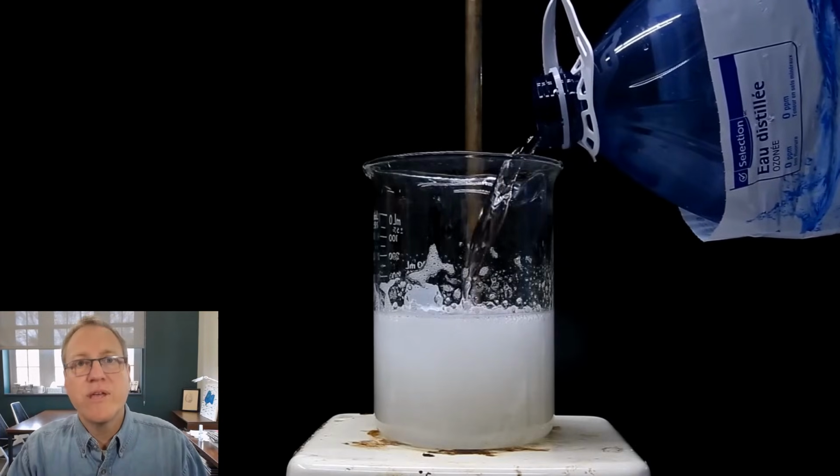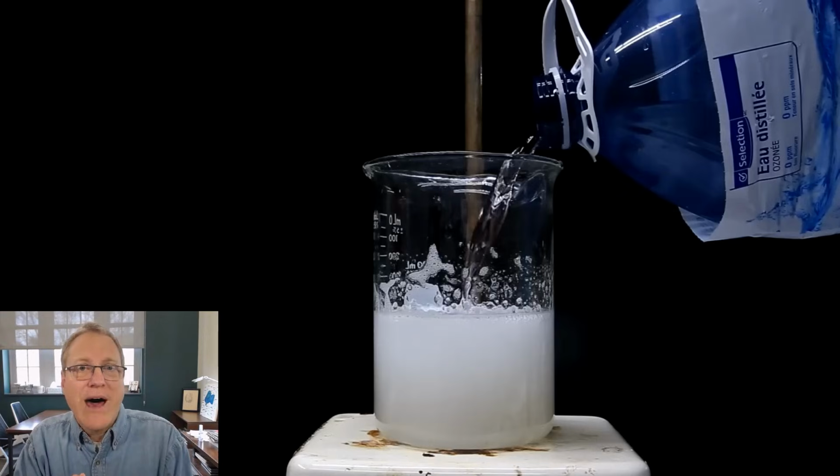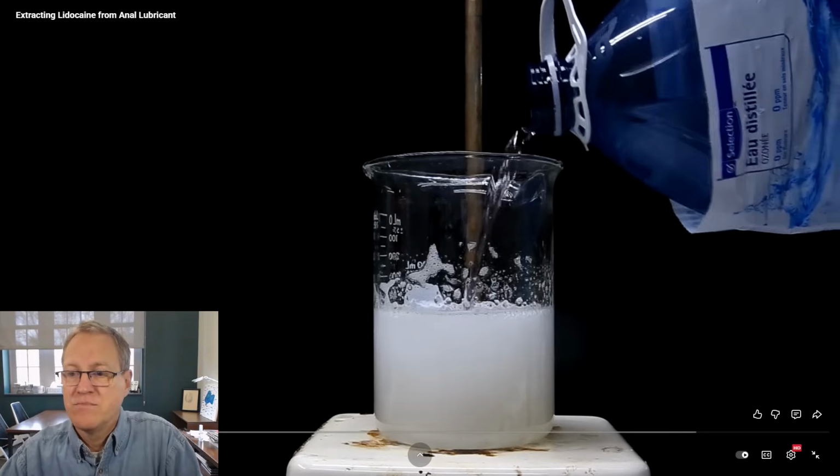Now listen, I'm not looking at this material in real life, and NileRed is, but my suspicion is that it's not a homogeneous mixture, it's that it's still so thick, there's not a whole lot of water in there, and therefore it's still quite a thick material. And as you swirl it around, you trap bubbles in, and the bubbles just make it so you can't tell what's going on in there. So he's adding more water, that's thinning out the mixture, and so that'll allow all these bubbles to get out, and it'll appear to be homogeneous, because it is homogeneous.